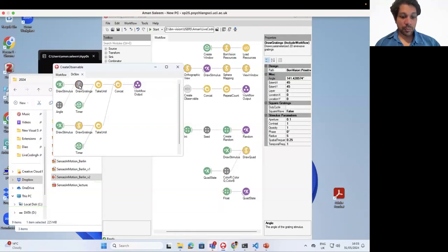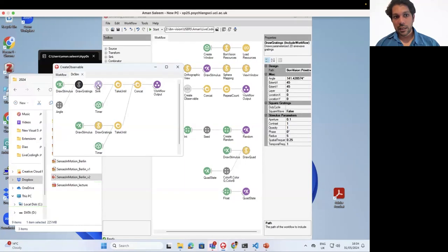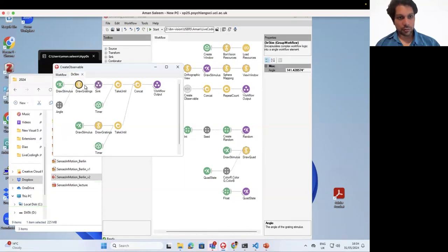So let's make this thing, what I mentioned before, is a sink. So in this case, basically a sink does not interfere with the process. It just continues, but it will just be run every time this draw gratings is run. So I'll take this sink, I'm going to call it update photodiode. Let's call it PD for photodiode, update PD. I'm just going to call it that.